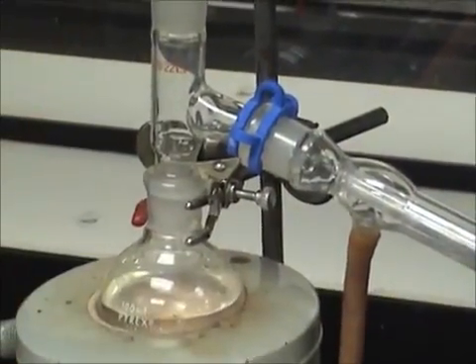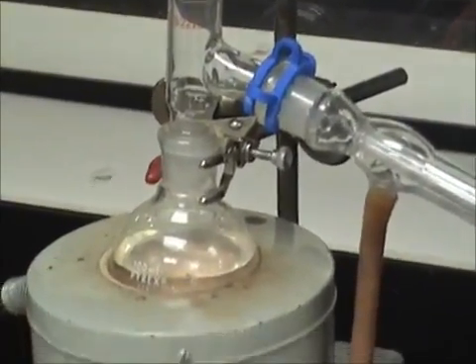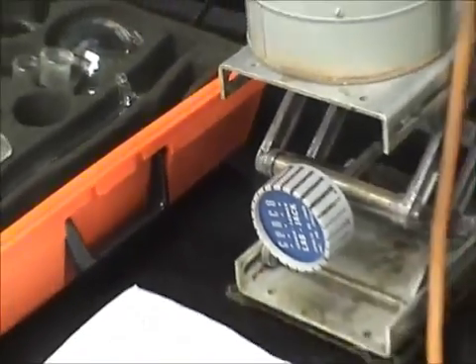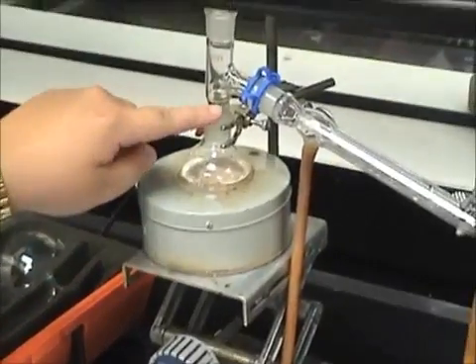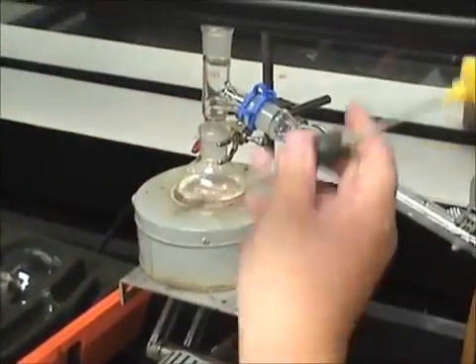Now let's finish this left side with the thermometer adapter. This will help record the temperature of our distillation. Make sure to have the tip of the thermometer just above the connection of the T-shaped head and the distilling flask.